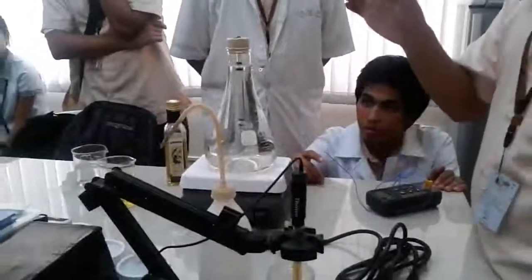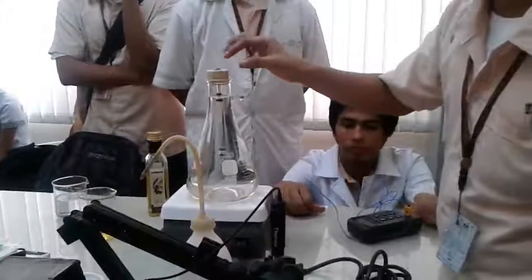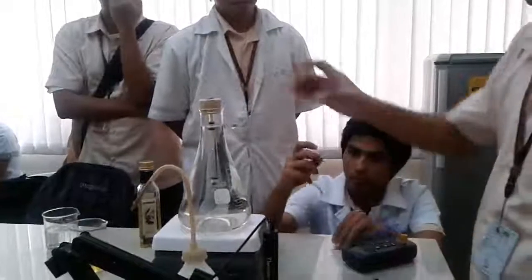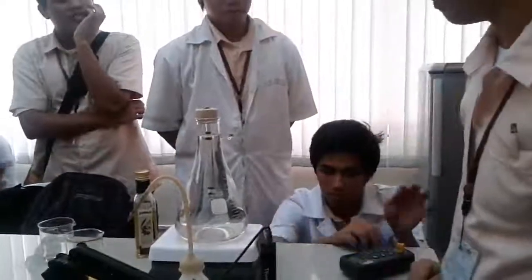And when dropping, you must not drop it abruptly. You must guide it from the brim until it is taken, because it will gain a certain speed if it travels through air.